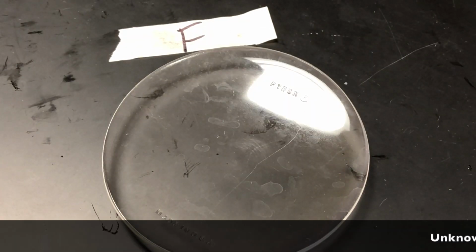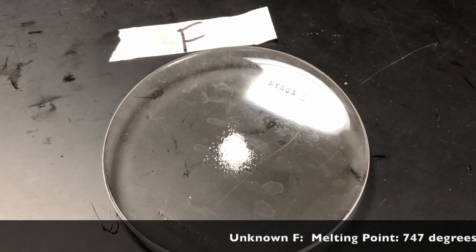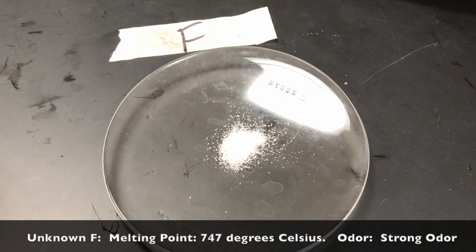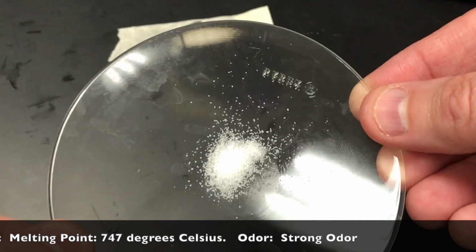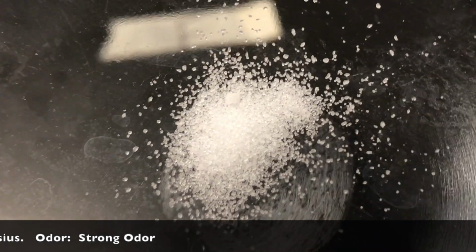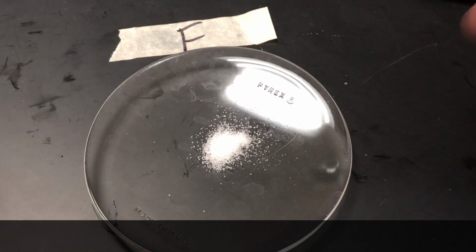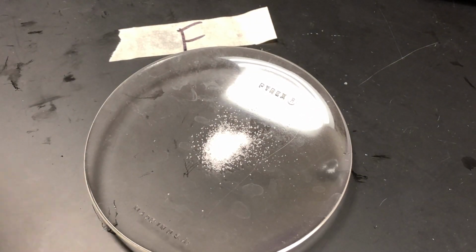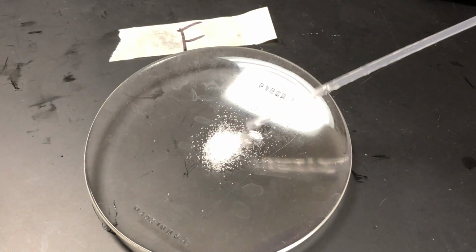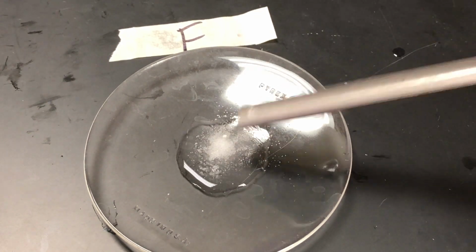One of the downsides of our current situation with the way school is running is that you can't be in person to see some of these tests. I hope you've been noticing the odor, and as you can see here, this one has a strong odor. It is very pungent, and I know in years past, whenever I have done this experiment with other students, several students have actually asked to sit down after smelling this stuff. So, although you can't really see the odor, it is very strong. So you can take my word for that.